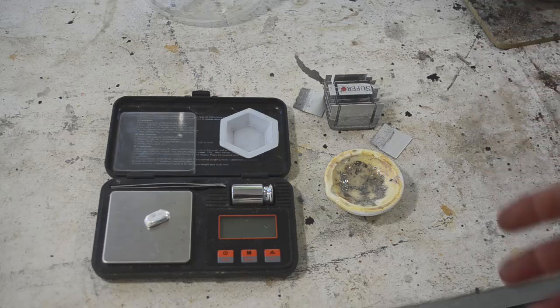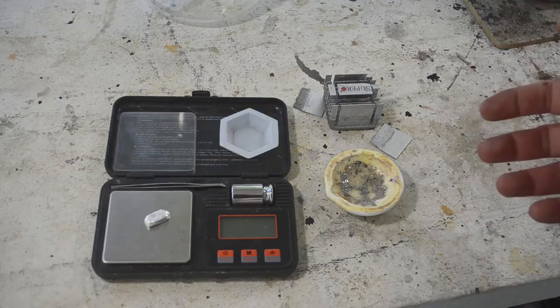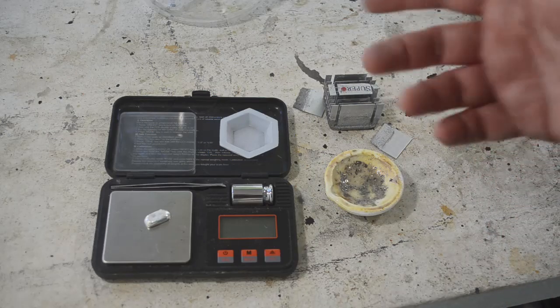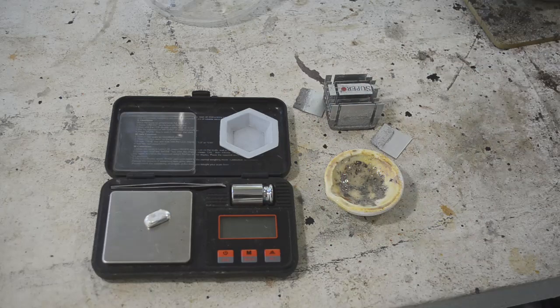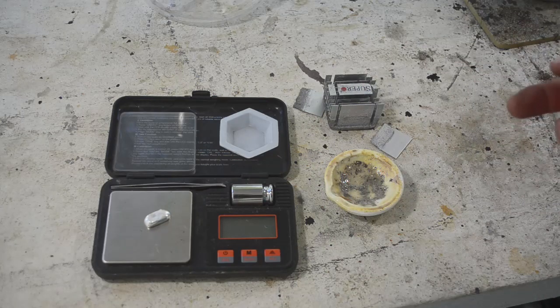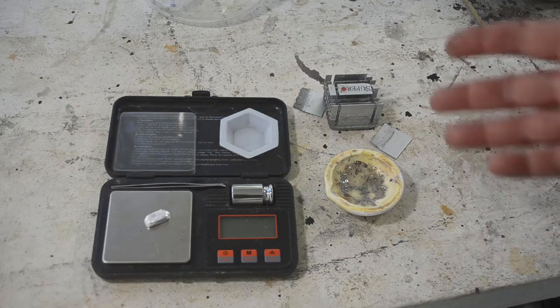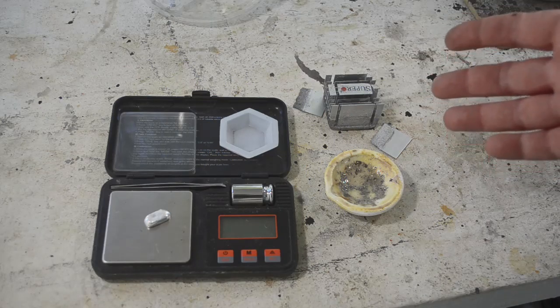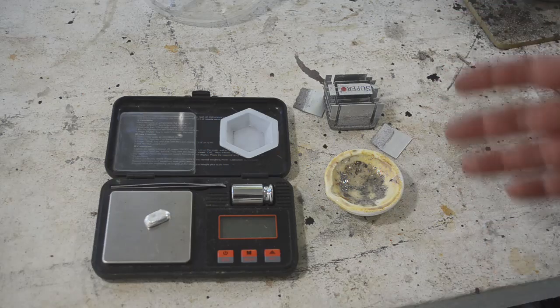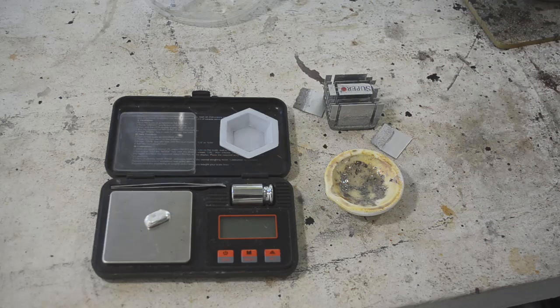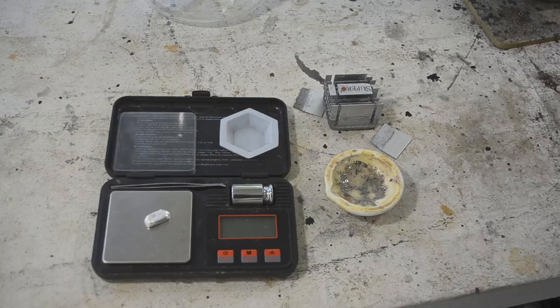I get pretty much 100% conversion of the silver chloride over to silver metal. It's really not that difficult. The reagents aren't that expensive. So yeah. This was an interesting experiment. But I think, you know, on the whole, it's kind of a failure. It really just doesn't work that well.